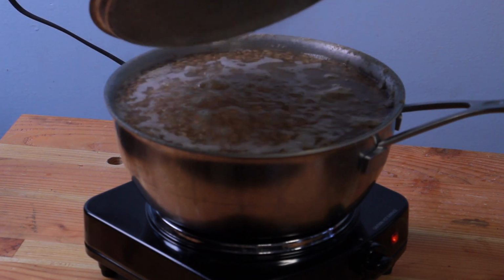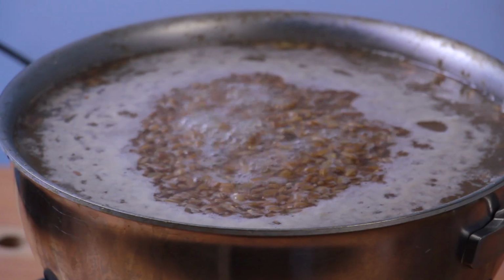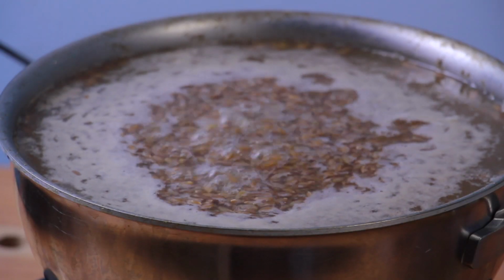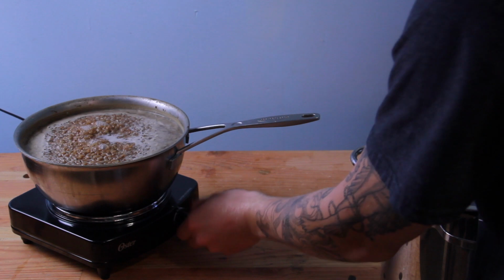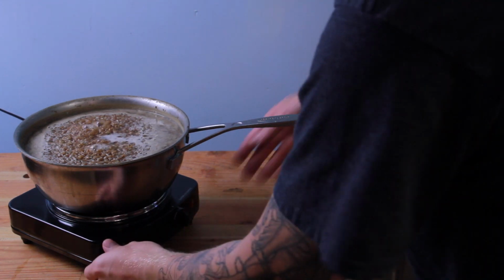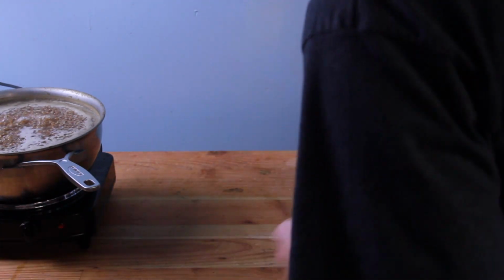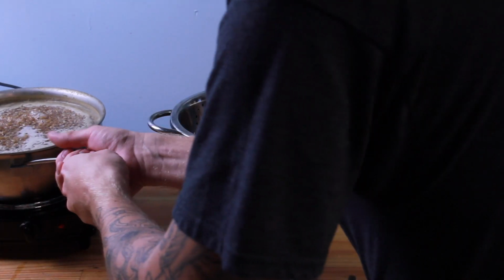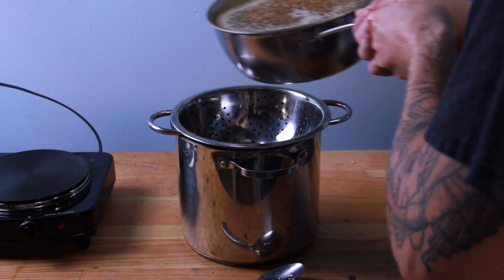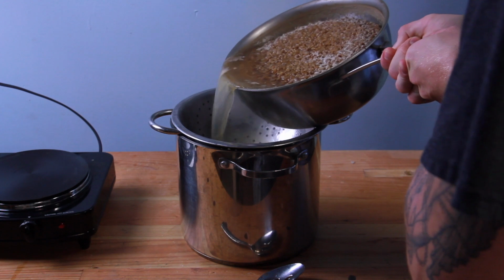This will effectively kill off most of the spores and bacteria that's already in the grain when it comes from the field, and it also helps our grain absorb as much water as it can. We want our grain to be fully soaked through, and the only way to do that is through boiling. After the boil, I strained the water off through a colander.